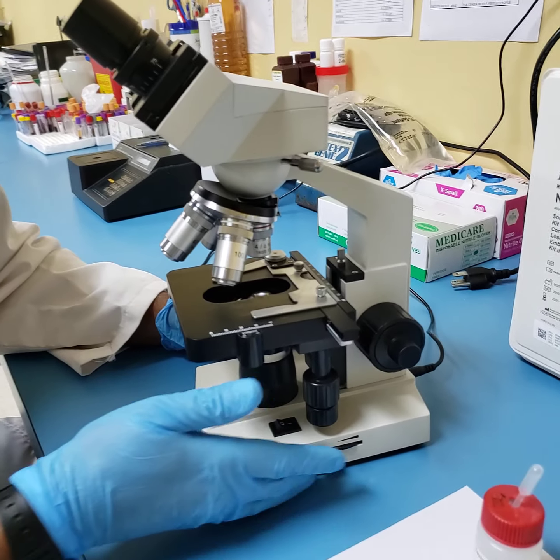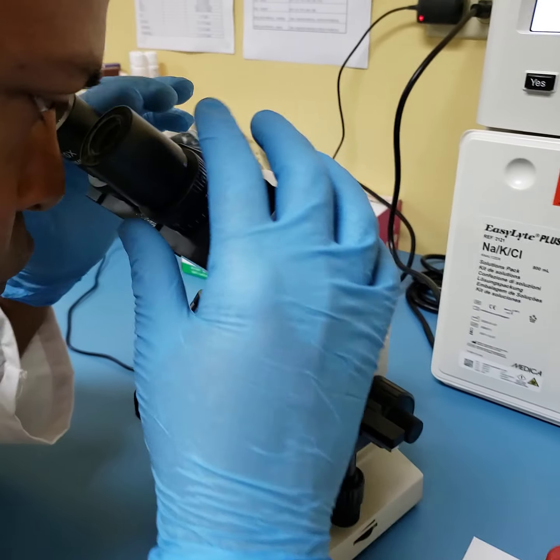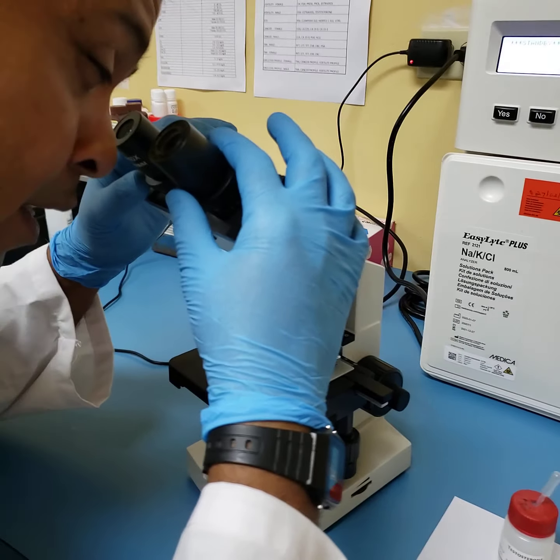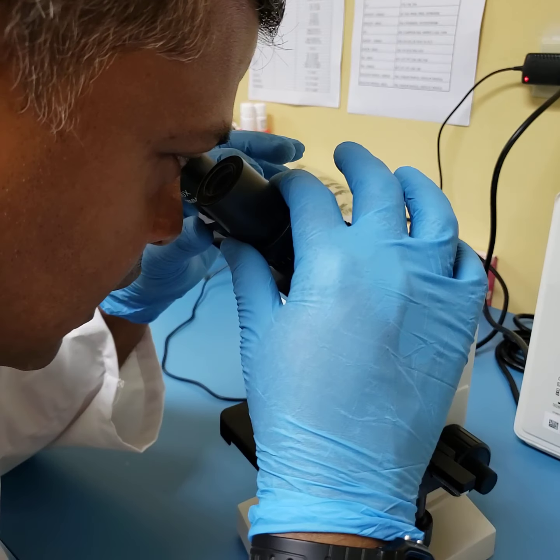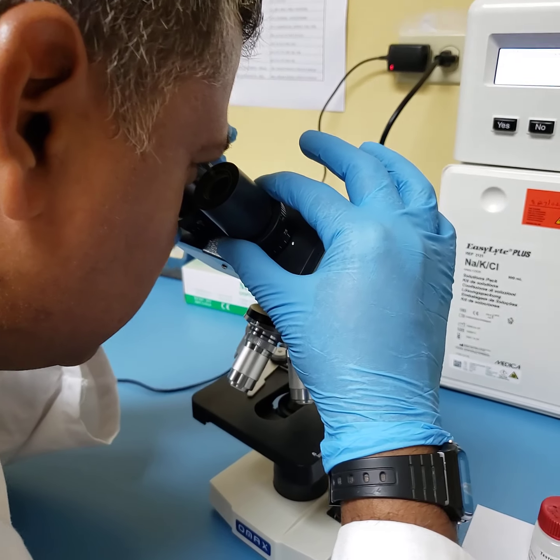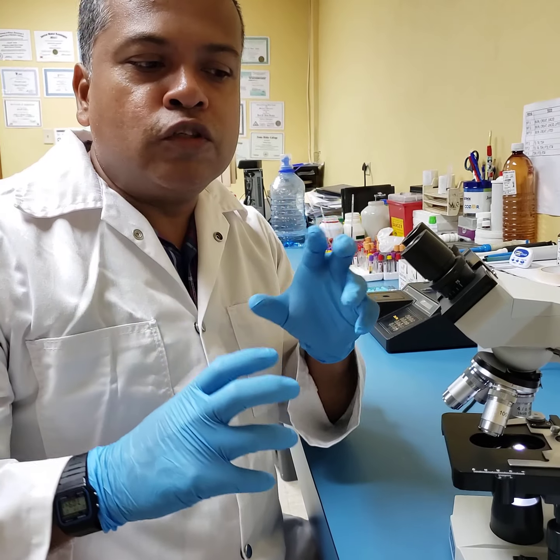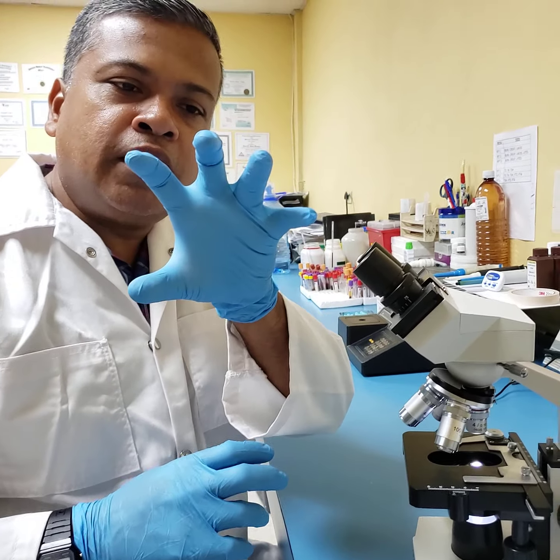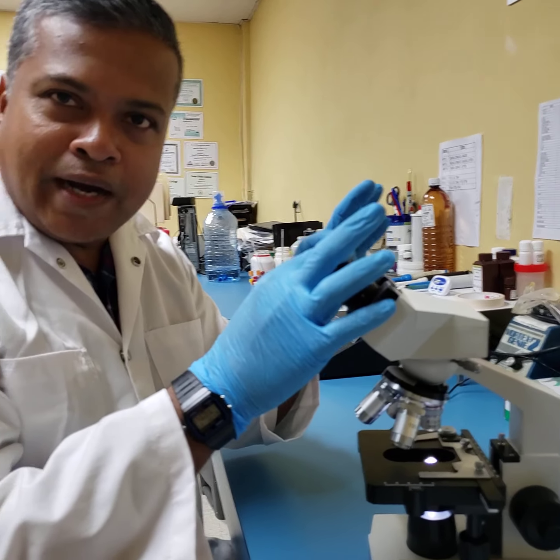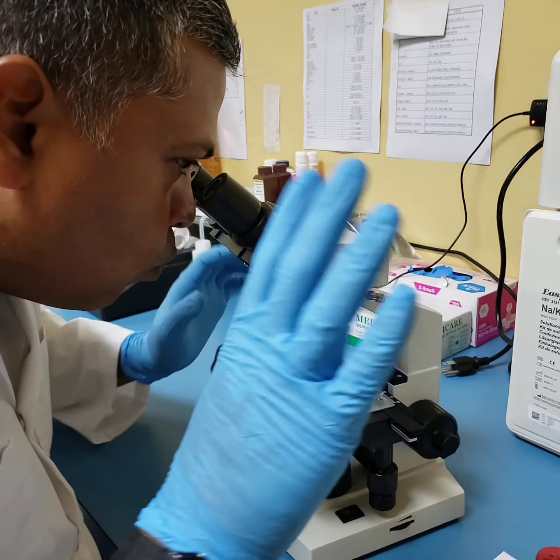When you have powered on your microscope, then look at your eyepieces, and what you do is keep both eyes open, not squinting and not partially closed, and you adjust your eyepieces until you see what I like to call one zone of illumination. That one zone of illumination is a circular illuminated area. Even though we are looking through two eyepieces, when we adjust the eyepieces to suit our eyes, you're going to see one full moon.